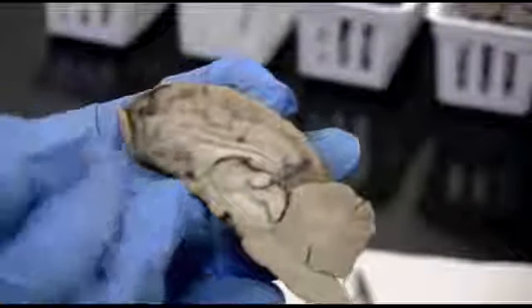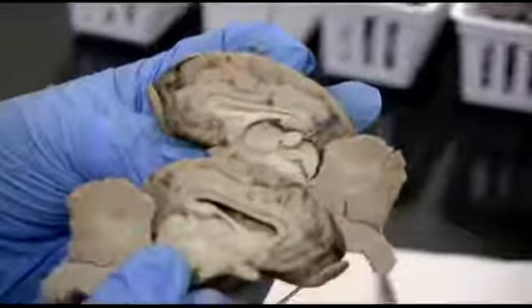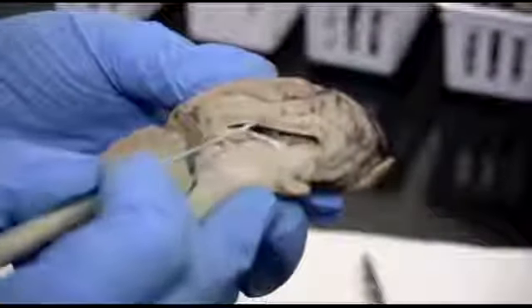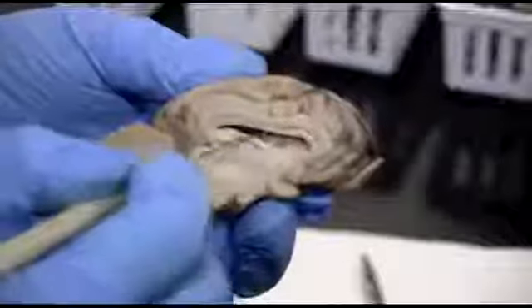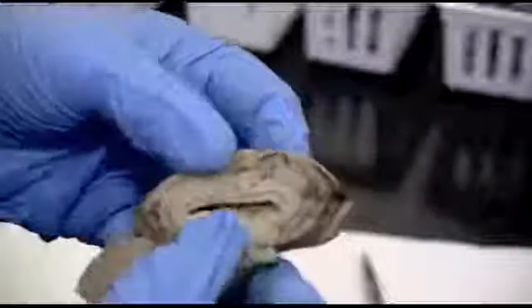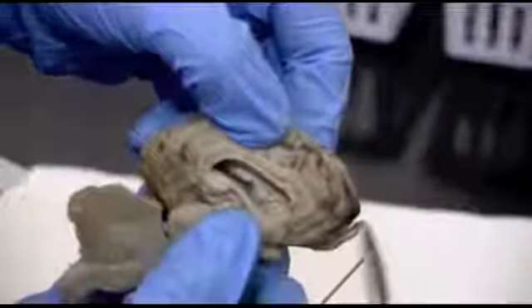And then when we open it up, if we look at the other half of our brain over here, we've got the same bit but no partition. I've cut it all to the other side. So here's the corpus callosum, and then here's the chamber, the opening, that's the lateral ventricle. If I just pull that apart, you have a really good clear view into this ventricle.